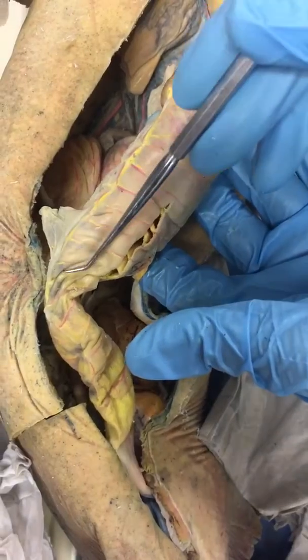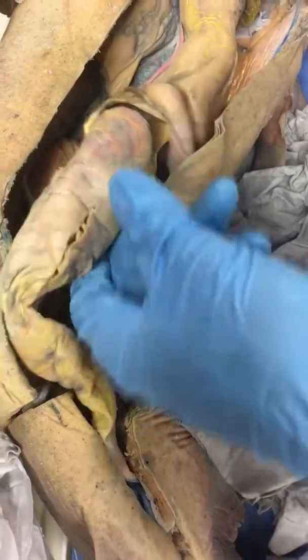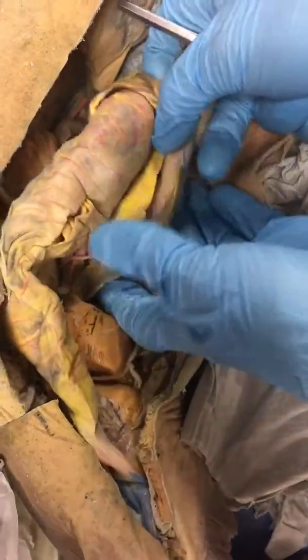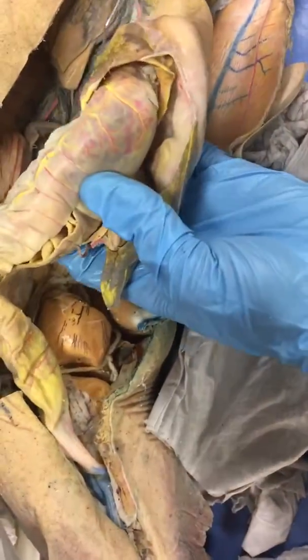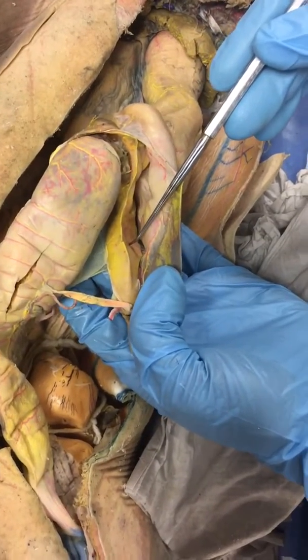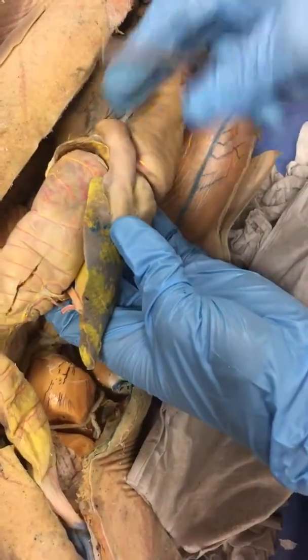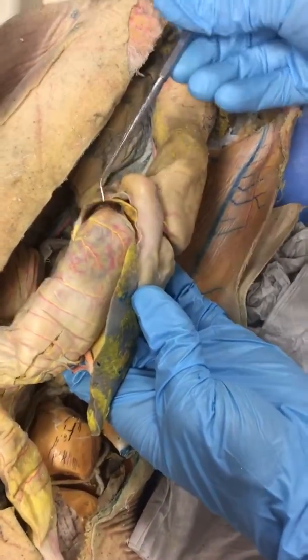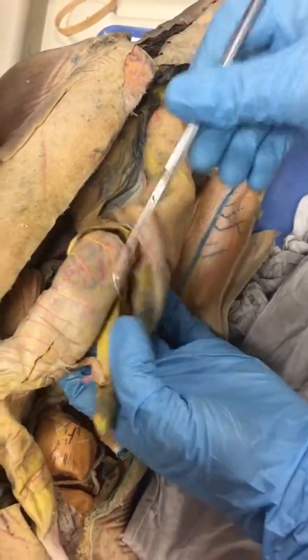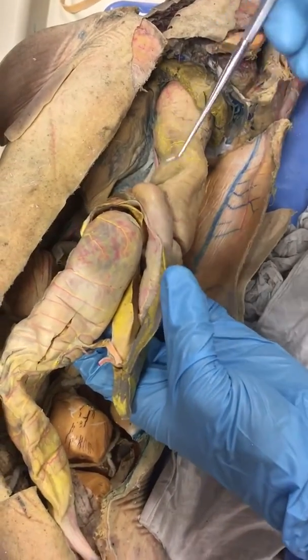Okay, so in the cat it goes similarly. But also by the duodenum, there's the pancreas. There are two lobes. This is the ventral lobe. This is the dorsal lobe. So if you think about it, on the rat, ventral is the tummy. So this is closer to the tummy, this is closer to the back. So that's why they're named that way.